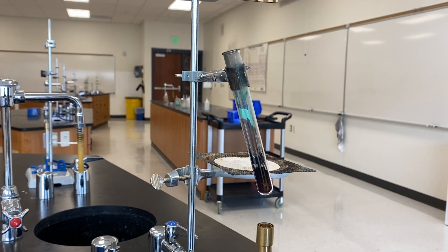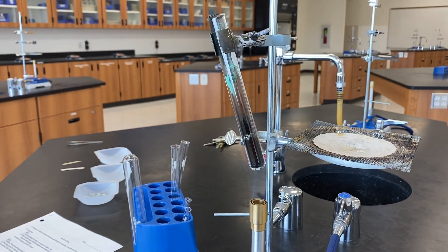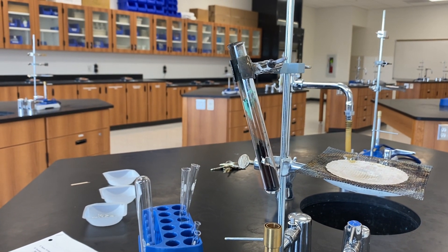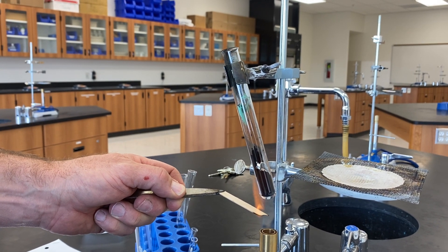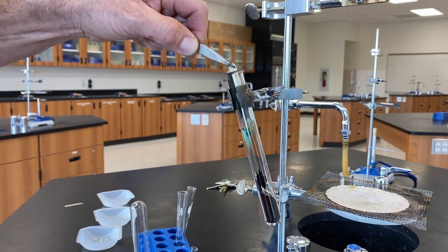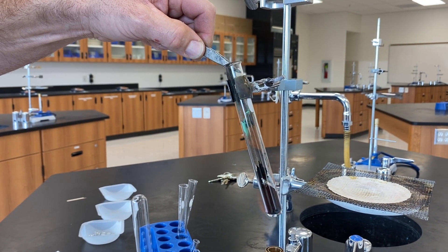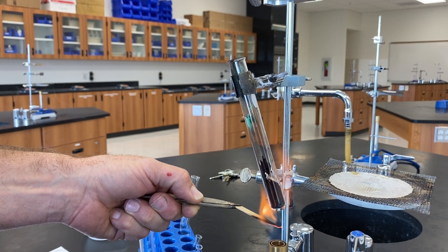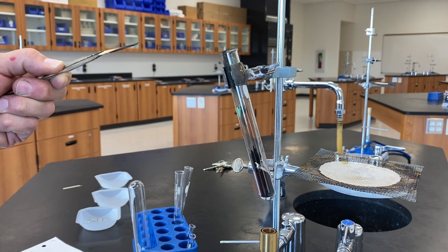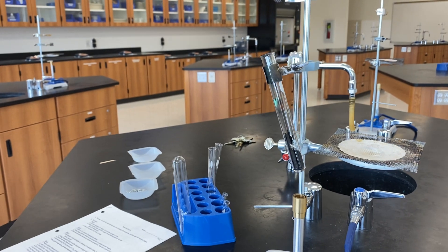As that reaction continues, we will get ready with a wood splint. Look at that going — it's going really well. What we're going to do is take a wood splint, light it on fire, and then introduce the splint into the test tube. We're going to do that again. And there we have it. We are now done with part three.